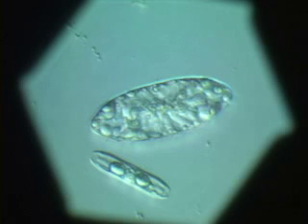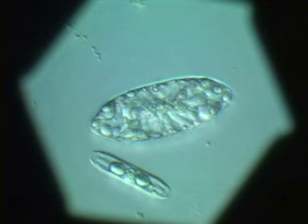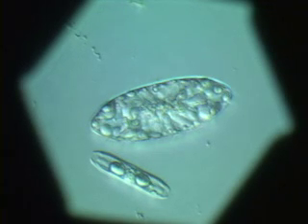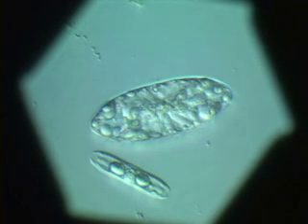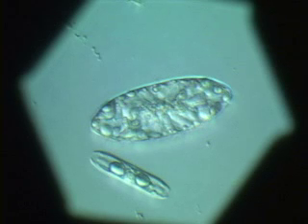What we see right now in the digital camera are actually diatom cells from the fast ice in Barrow, and they're pretty big.